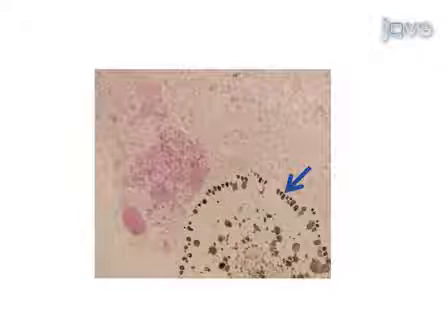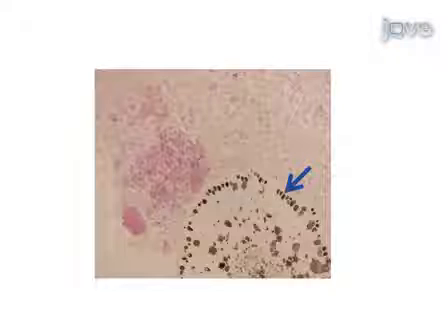The AV marker also allows for the orientation of different cells in particular sections to be followed in different serial sections on other glass slides.